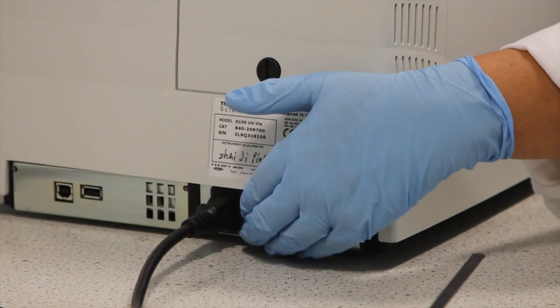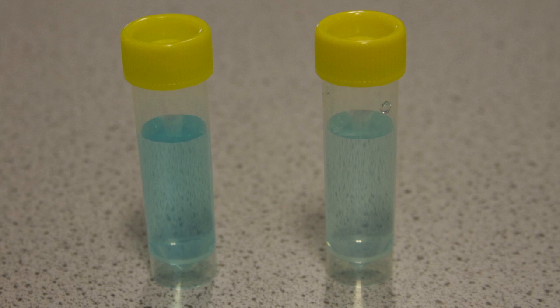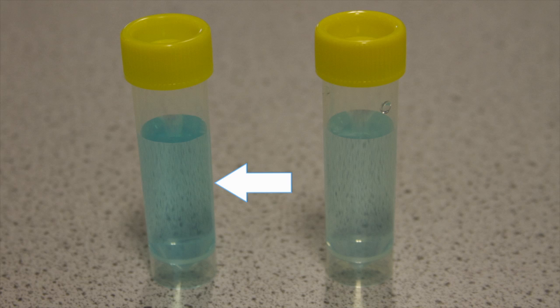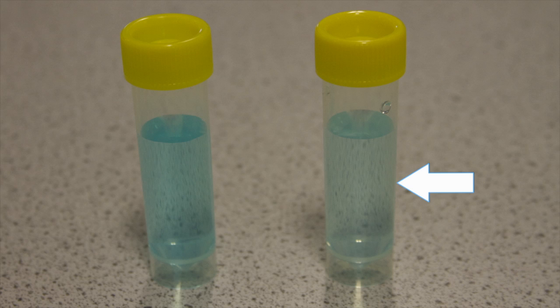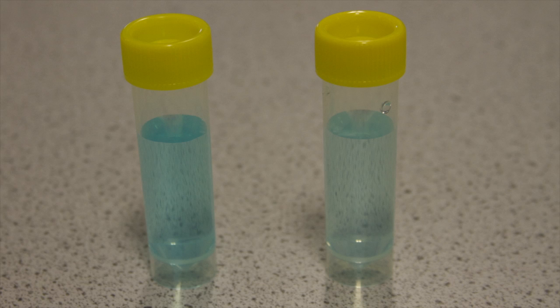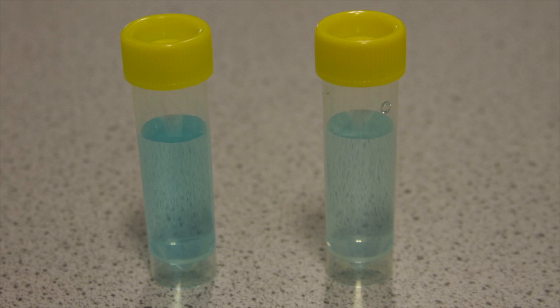Start by turning on the machine using the switch at the back. Here we have two different samples of copper sulfate. This one is prepared to a concentration of 50 millimolar and this one to a concentration of 25 millimolar. You can see that the less concentrated solution appears paler. We will use the spectrophotometer to measure their respective absorbance.